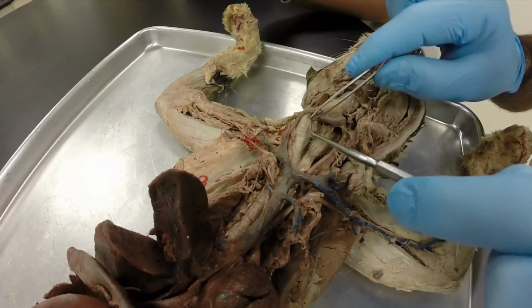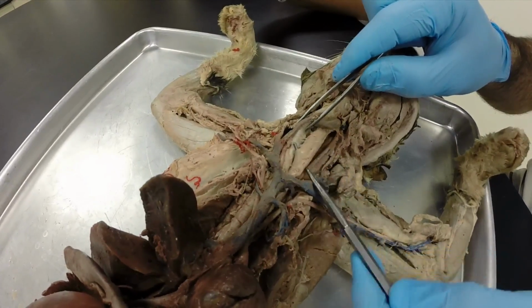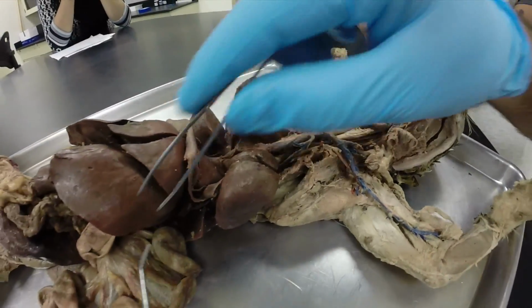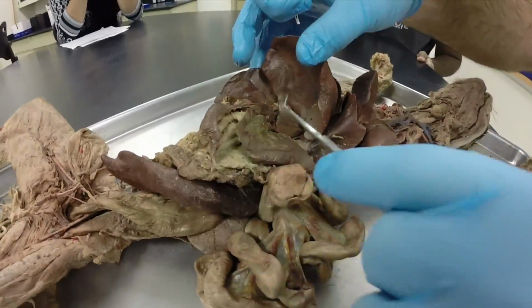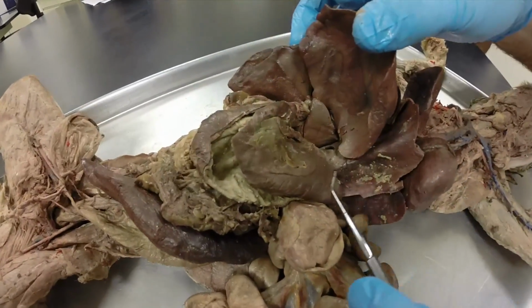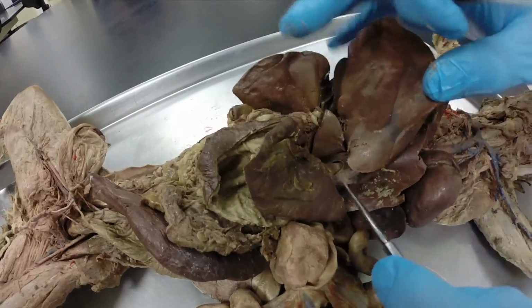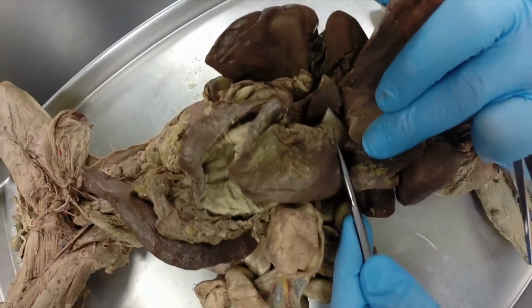And then if we go directly underneath this trachea here, you get this large muscular tube, and this is the esophagus. So this is going to travel down and enter into the stomach. And so we can keep going there. So this is our stomach right here. And you can see it has kind of this J shape to it where it comes down, curves, and curves back upward. And so right here is where the esophagus is coming in. There's our esophagus right there.